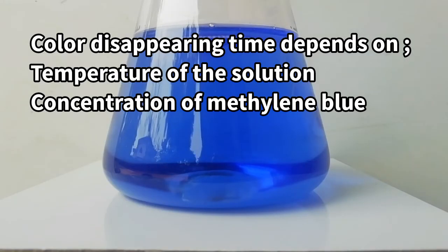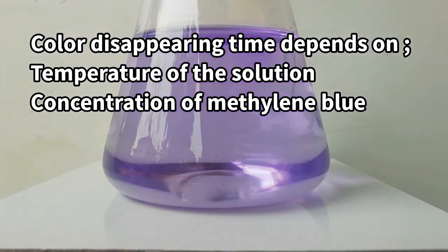For this experiment, the color disappearing time depends on two factors: the temperature of the solution and the concentration of the methylene blue.